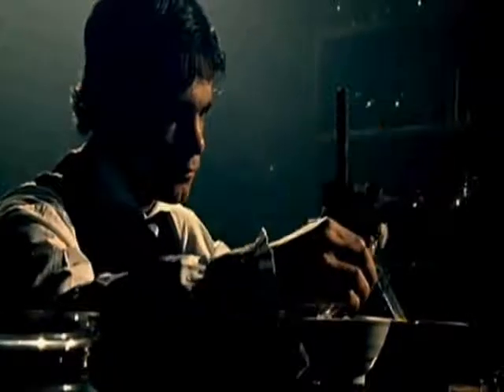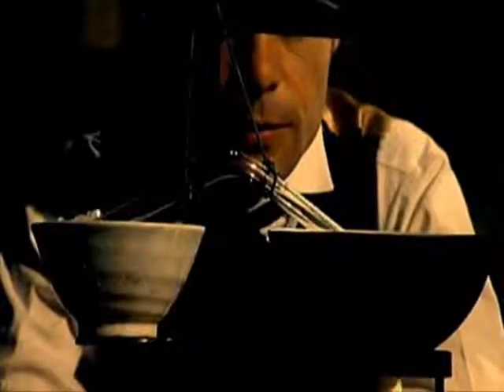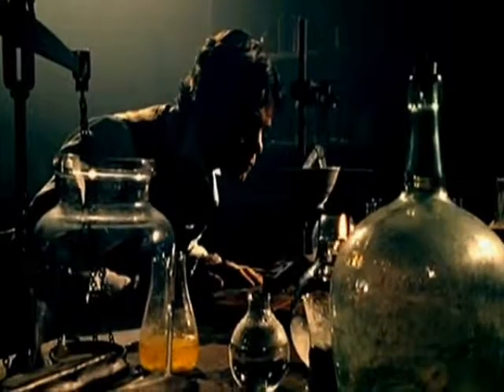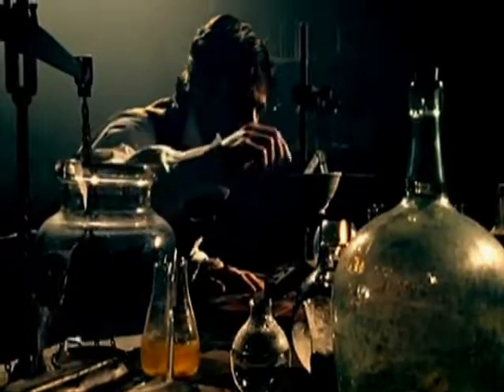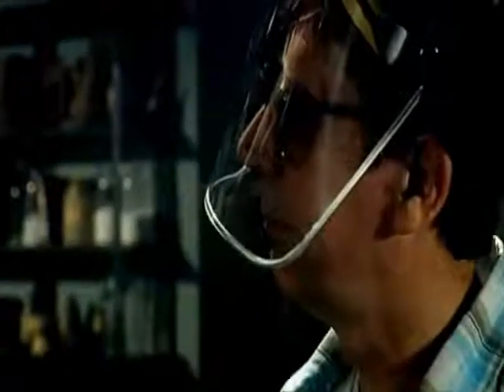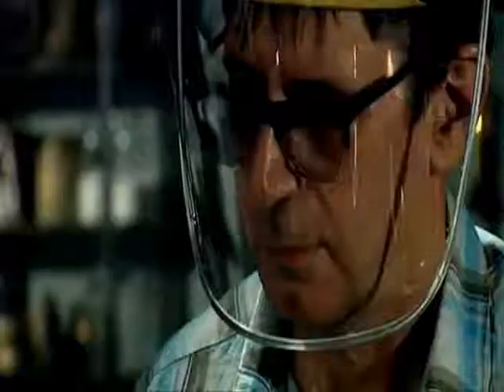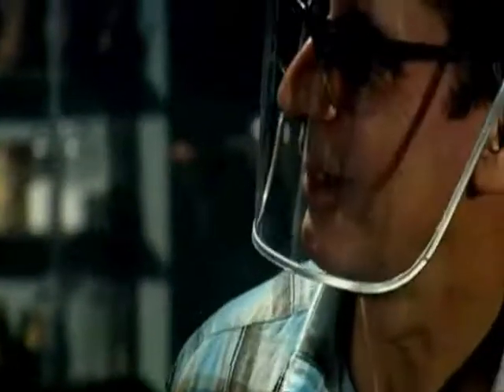In the original experiment, Faraday took the sealed tube and heated the end containing the chlorine hydrate in hot water. He put the other end in an ice bath. Soon he noticed yellow chlorine gas being given off. Because a gas is being produced, pressure's building up. Ray, this is where it starts to get dangerous. So if you now take a few steps back.